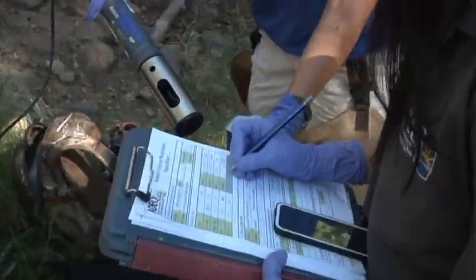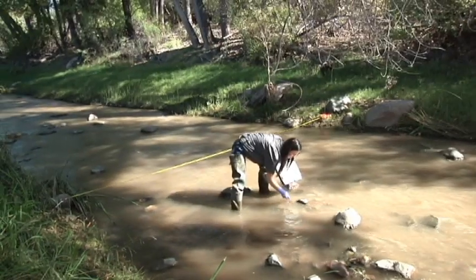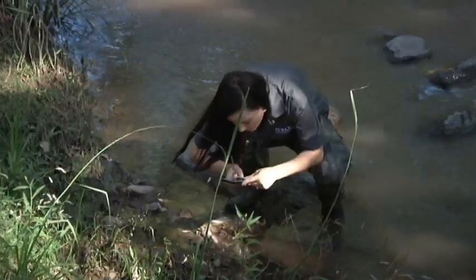We're going to collect E. coli and dissolved oxygen, particularly for the stream — we have various parameters that we look for. Today we'll be collecting general field parameters: DO and pH, temperature, conductivity, those kinds of things. And then we'll be collecting metals, nutrients, and inorganics.